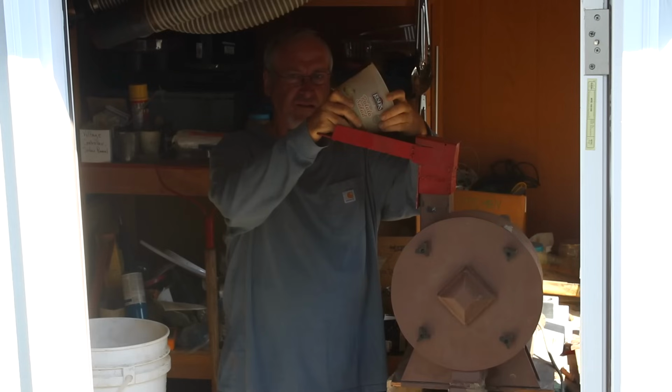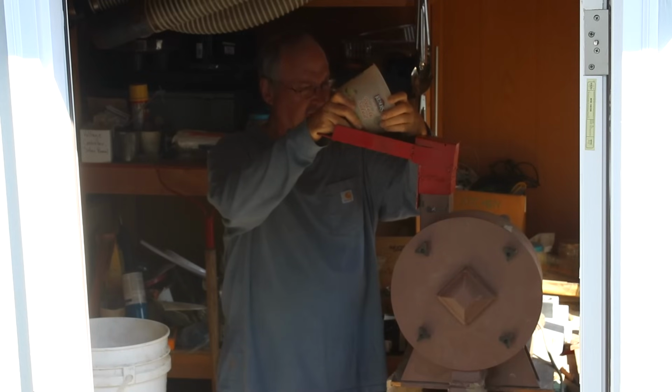And then what happens is the chains slow down because they're beating against the pile of ore that's in there, and then it trips the breaker, and so it's a big mess. So you really don't want to load it in too fast, just a little at a time. That's why you see me being super careful.